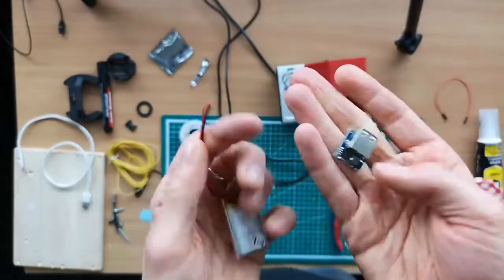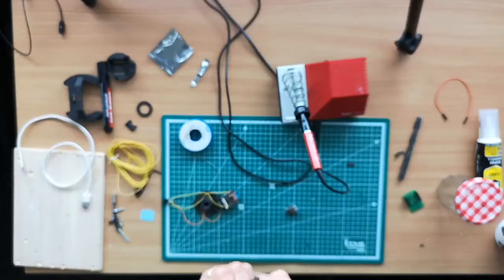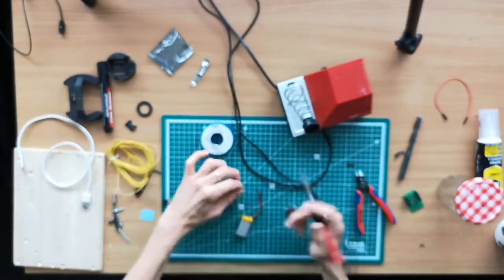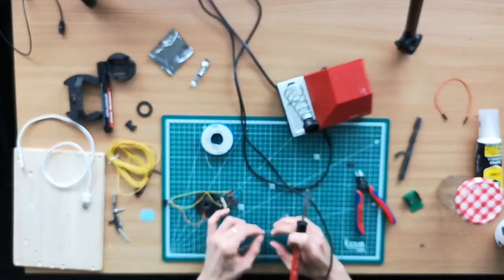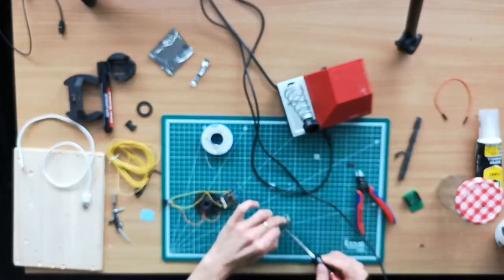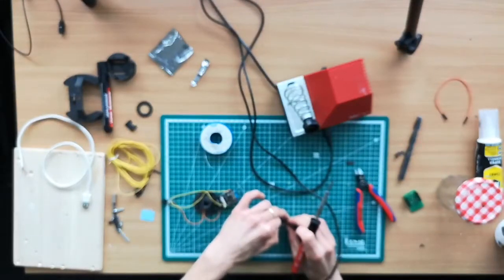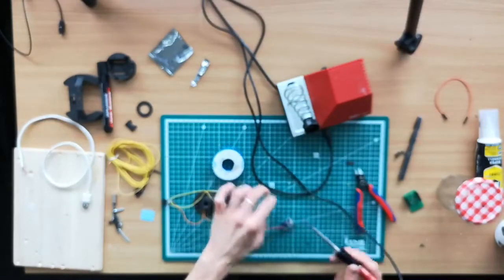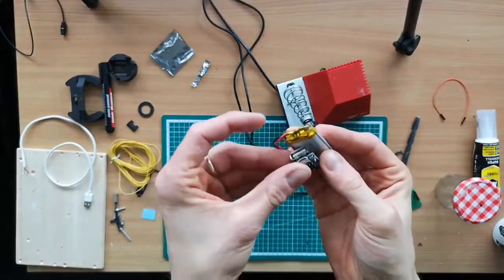And for this, we wire this part here to the power bank adapter. So we again remove the isolation. Add some lead. And connect, of course, ground to minus. And plus to the red one. So that's that part here. So you have a small power bank now. You can also take another one, but this is the smallest combination of power bank you can get.